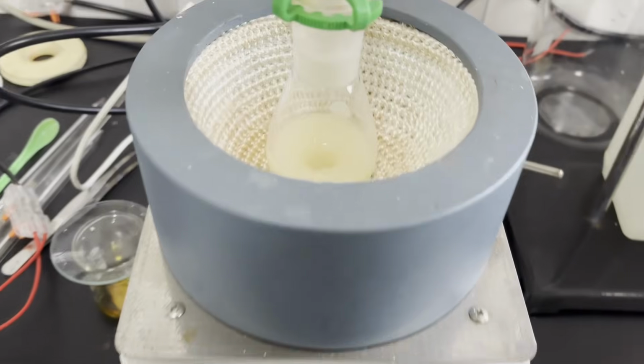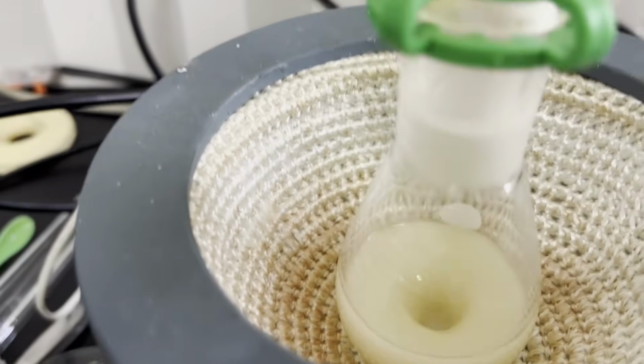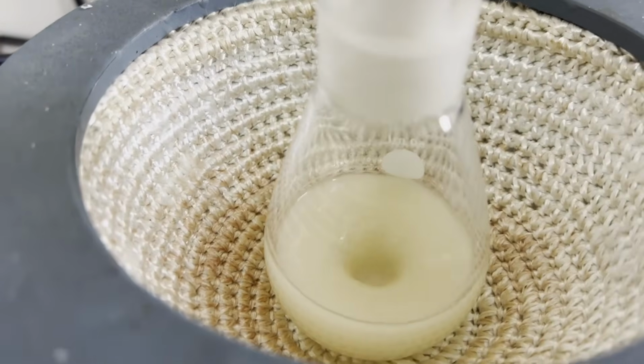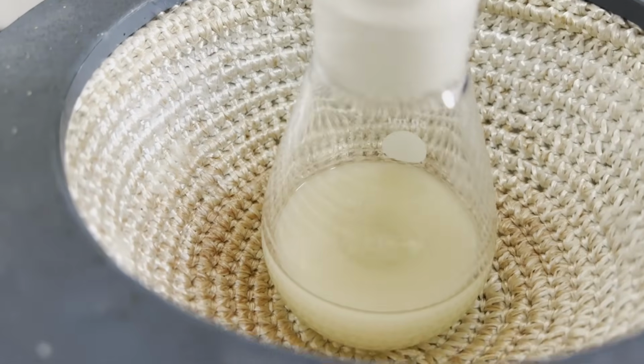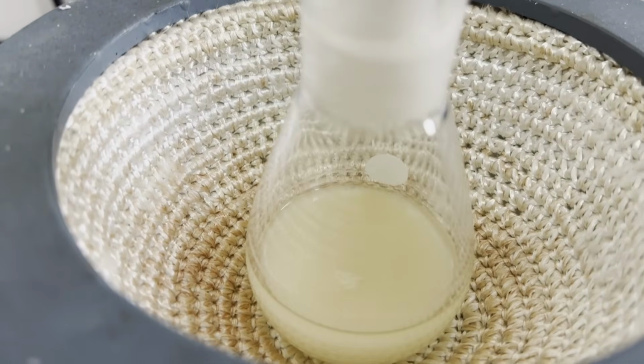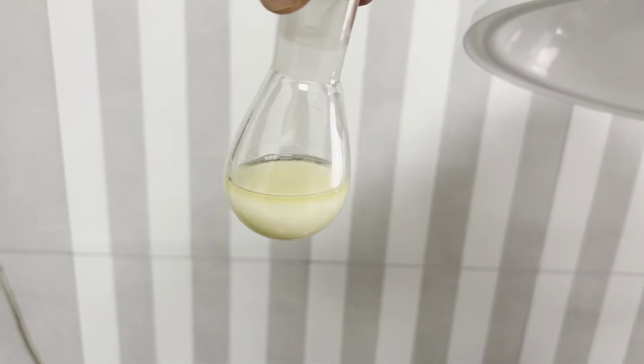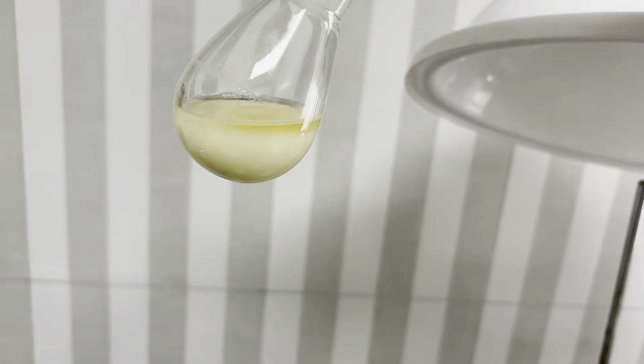And after the same 2 days, a lot of solid precipitate appeared in the reaction mixture. So indeed, a higher room temperature makes the reaction proceed faster. You can see that the solid has a lighter yellow color than the solution. Now I'll be honest, for just a split second, I thought that this may be my product. But I still decided to follow the literature workup procedure instead of directly filtering the solid out and testing it with TLC.